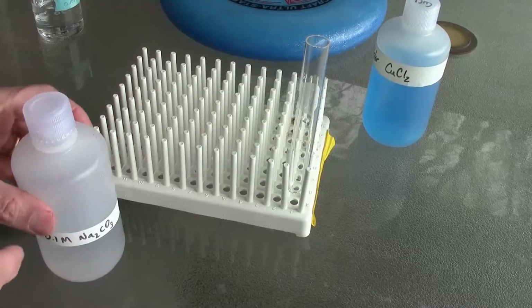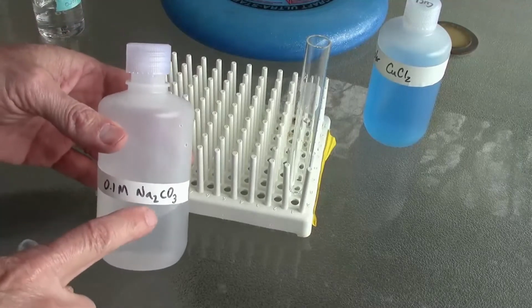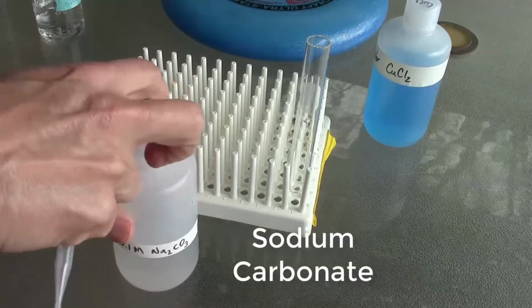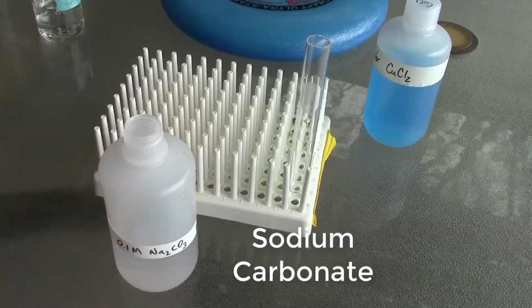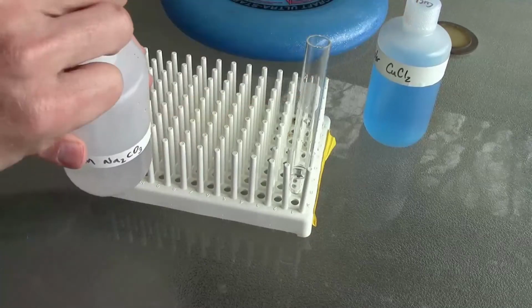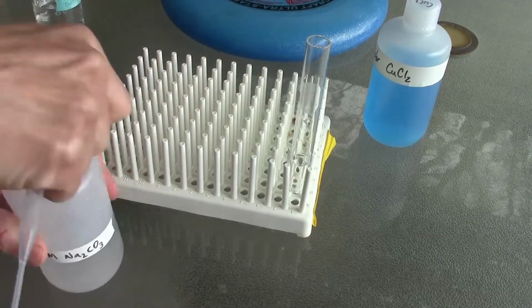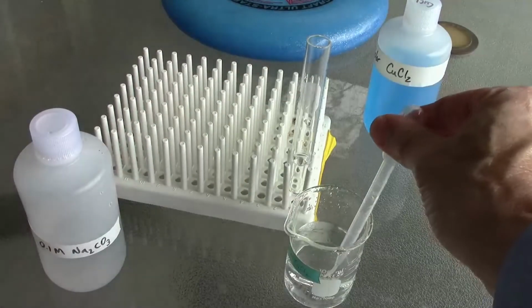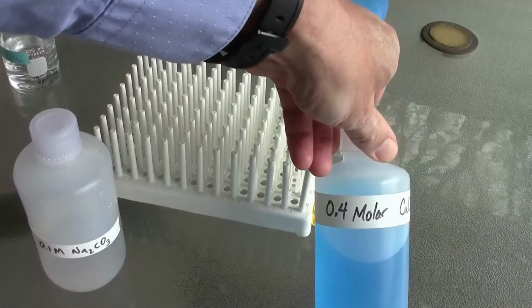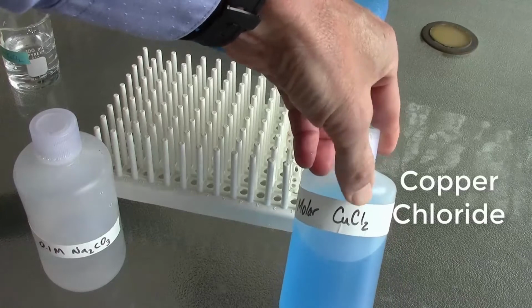Here I'm running a reaction in my backyard. This is sodium carbonate. I'm hoping you can read that label. I'll put some in the test tube. Now I'm rinsing my pipette. And now I'm ready to add some copper chloride.